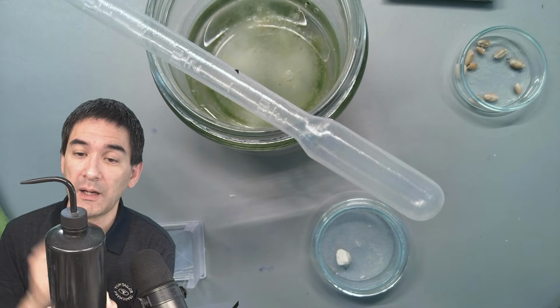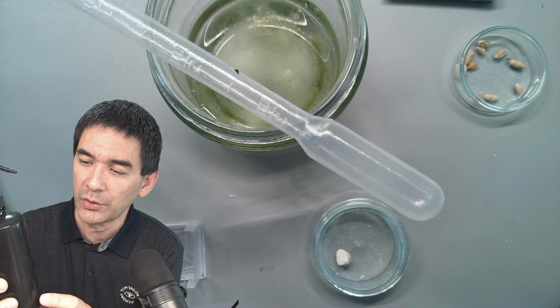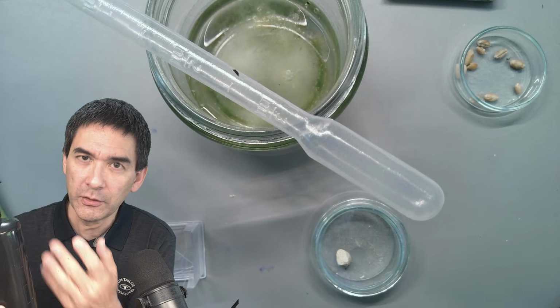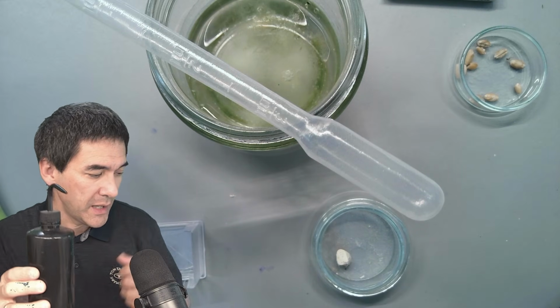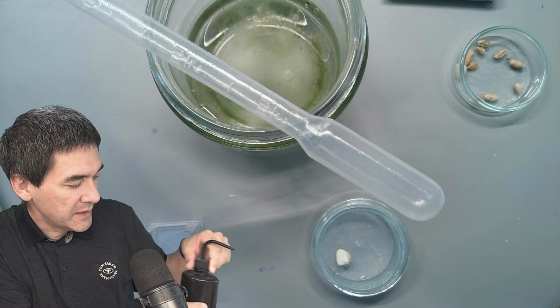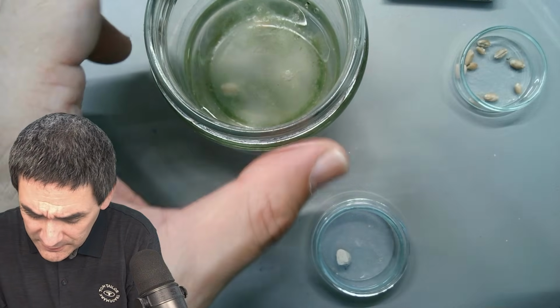However, there's one concern that I have, and I don't know to what extent it's a valid concern or not. It's soft plastic. I don't know if it's giving off some kind of chemicals into the water, which might be harmful, right? So that's something I don't know. Sometimes they add some of these chemical substances to make the plastic soft. So that's pretty much all.